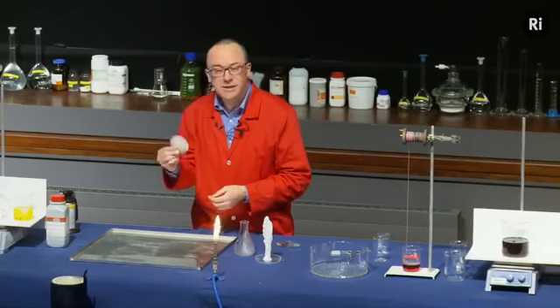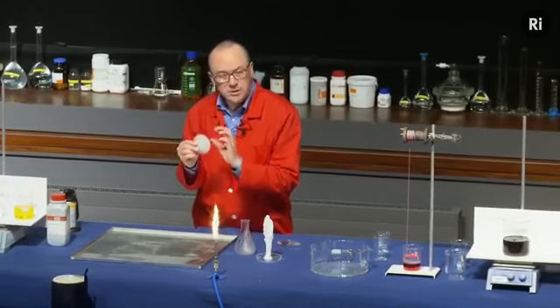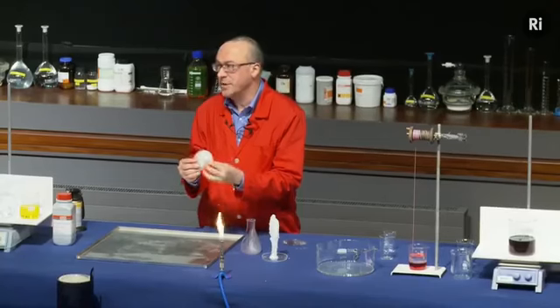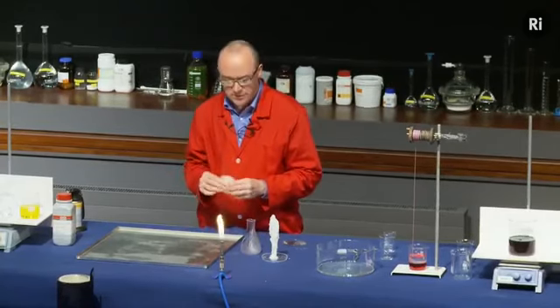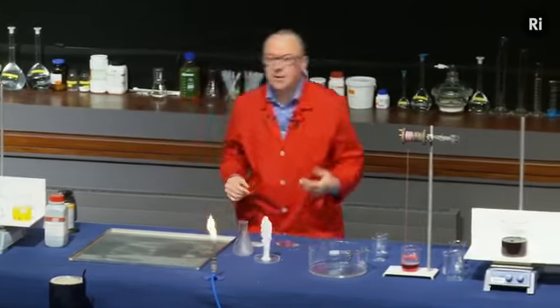And then I can take this and put it into boiling water for a couple of minutes. The crystals will turn back into a liquid. I can allow it to cool, and they'll stay as a liquid, and it'll stay like that for weeks or months until I'm ready to use it again. We can use it thousands of times. Okay, so that's sodium acetate, a sort of chemical sculpture.